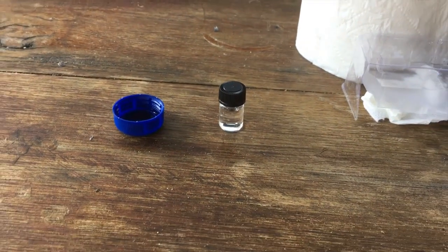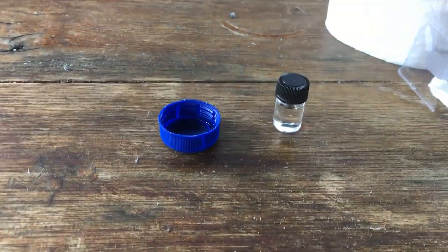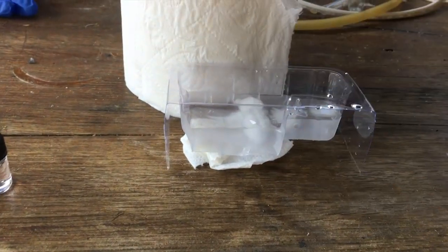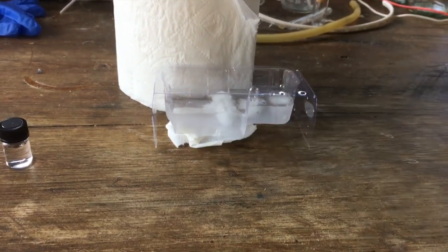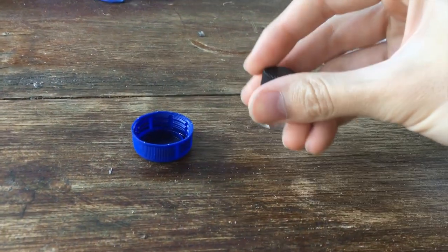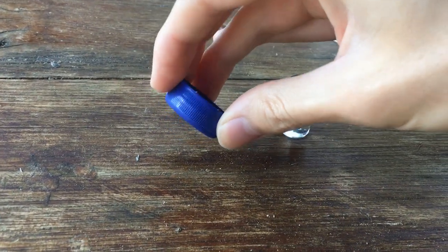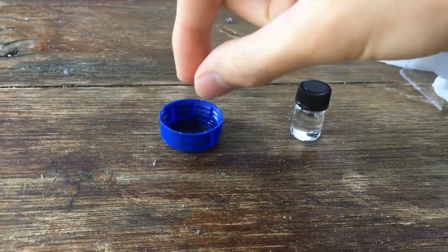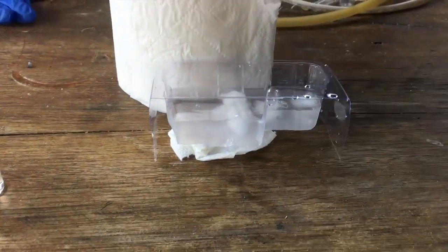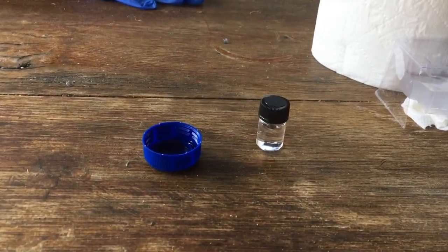The next thing we're going to do is the experiment everyone loves. We'll take a little bit of this heavy water, freeze it into an ice cube, and then drop it in some normal water and see it sink to the bottom instead of float like regular water. So to do that, I'll open up this vial, pour a little bit into this bottle cap, stick that in the freezer, and then the ice that we'll make, we'll take out and just stick it in that water that we have from before and see the ice cube sink. So I'll go ahead and do that now.